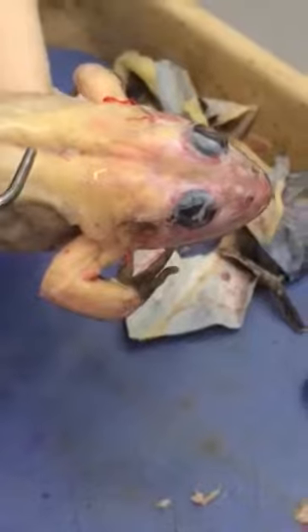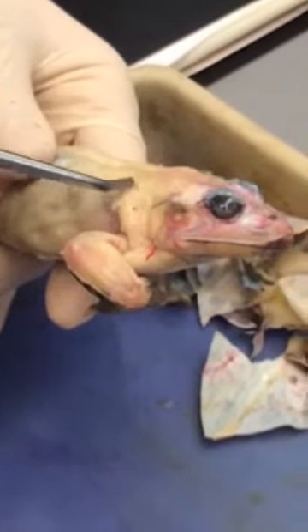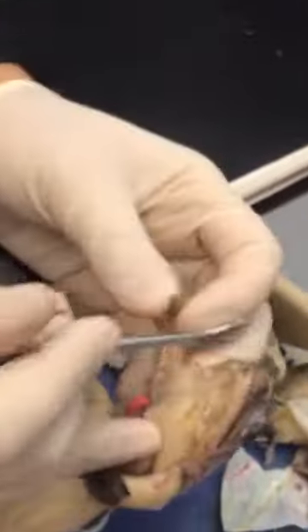Sorry, not the longissimus — this is the longissimus dorsi. Excuse me: longissimus dorsi, latissimus dorsi over here. And the deltoid, which we've got over here.